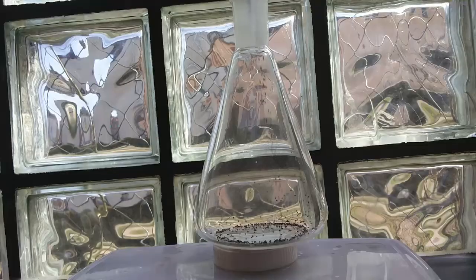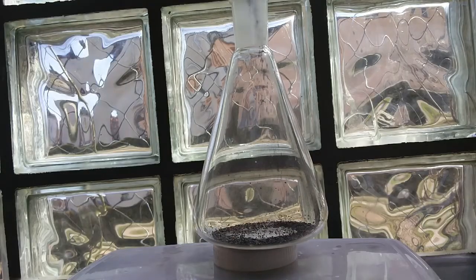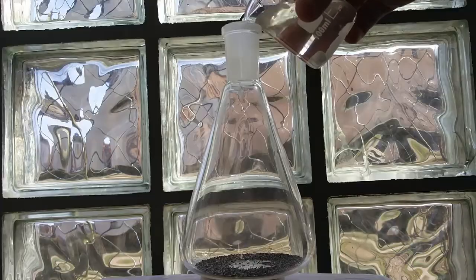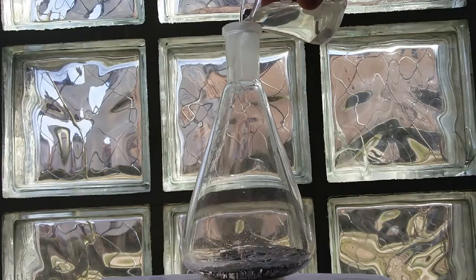Next we add 5 grams of magnesium turnings to an Erlenmeyer flask, add the nitrate solution to the magnesium.